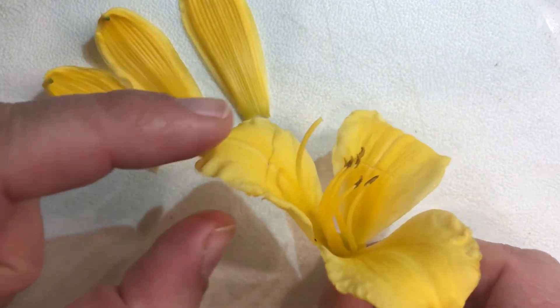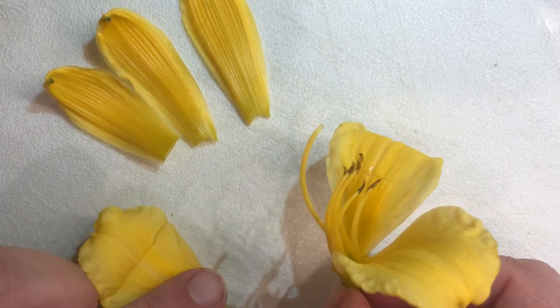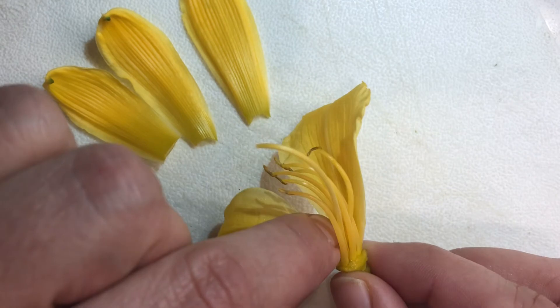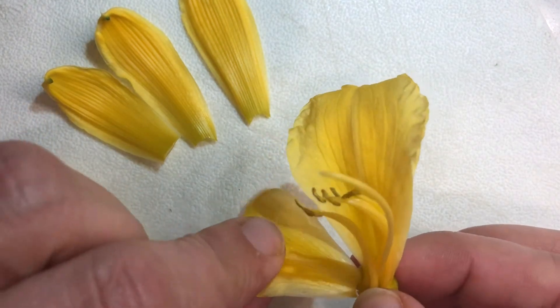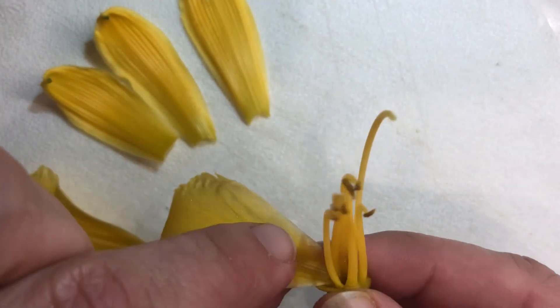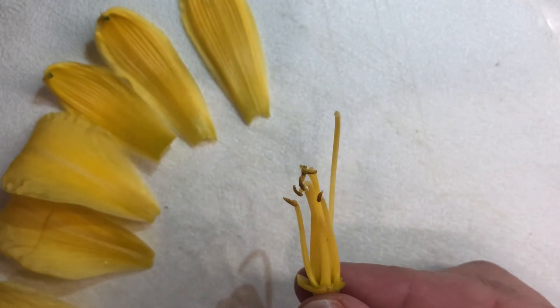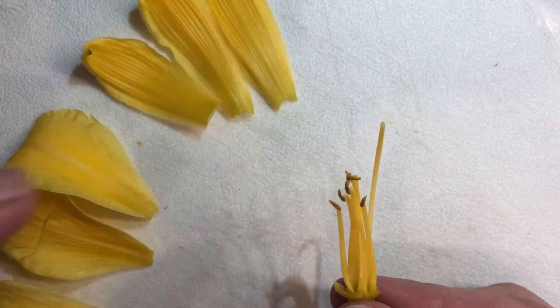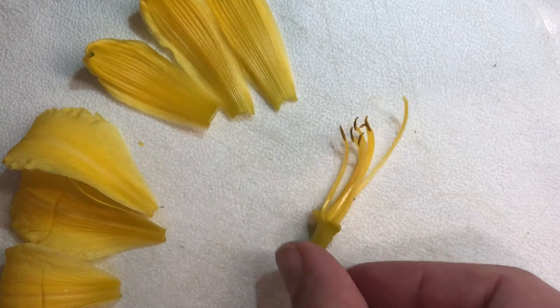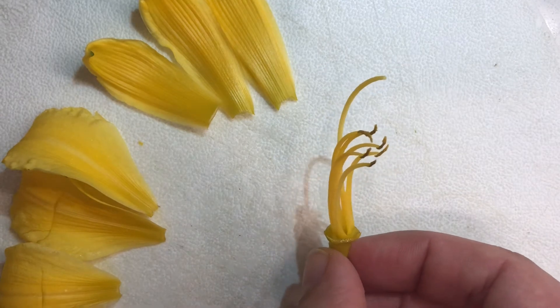Then we're left with the petals, and the petals have the job of attracting the pollinators. This lily is very likely pollinated by an insect because of its yellow color. So now I've taken off three sepals and three petals, and I'm left with the male and female reproductive structures of the flower.